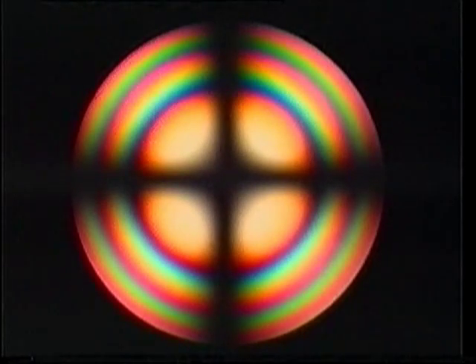The retardation, the product of birefringence and thickness, determines the number of isochromes. The following figures show the effect of decreasing retardation. Here the maximum interference colour is third order red, maximum interference colour second order blue, and maximum interference colour first order grey to white. Most centred uniaxial interference figures are like this one and lack isochromes.